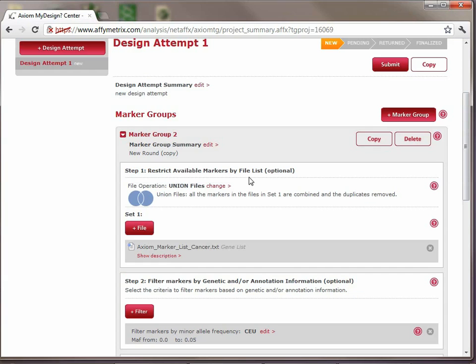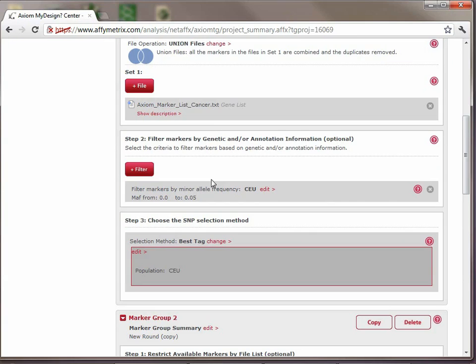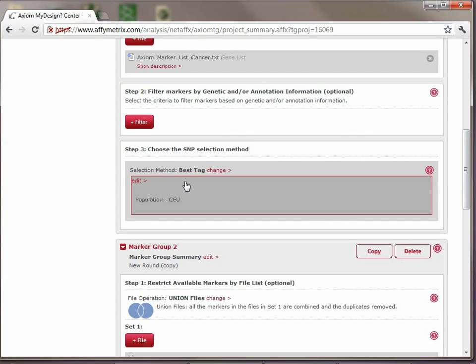Okay, so we've got two marker groups. Now the third set of SNPs that we were interested in, or markers that we expressed an interest in this hypothetical design, was all of the markers associated with the cancer genes. So let's go ahead and create yet a third copy of this marker group. Open it up. Again, we have the cancer genes. Now in this case, we don't want to filter based on any specific criteria of the markers themselves, so delete that filter. And now we need to choose a SNP selection method.